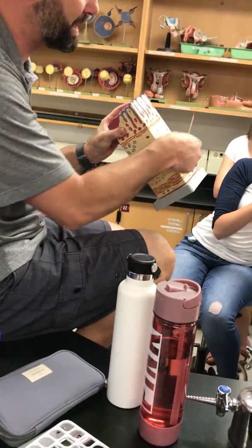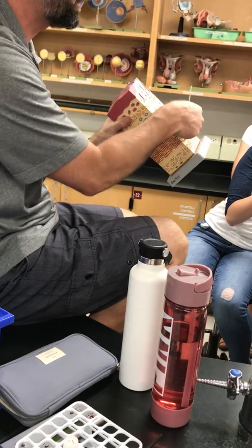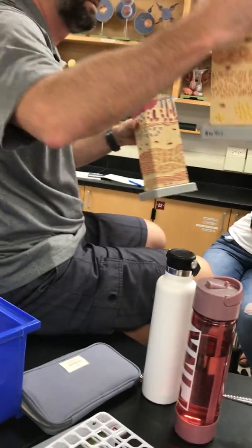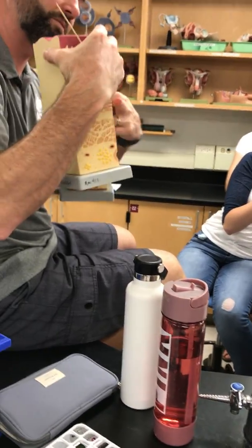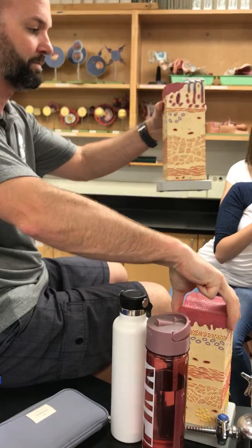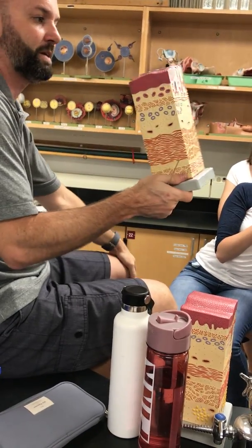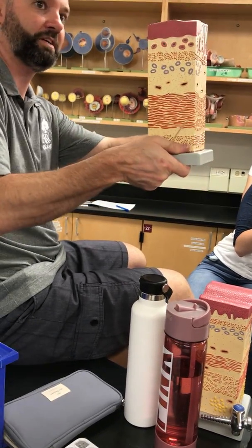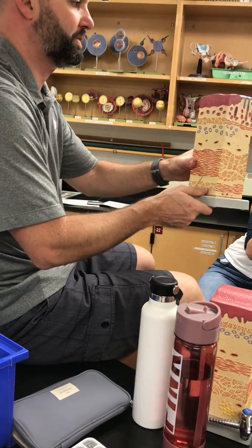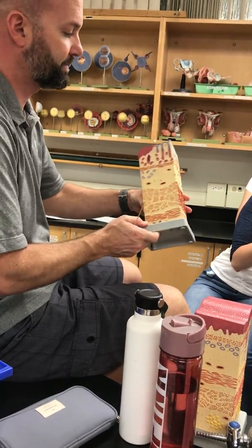But what do you notice about the thickness of this circular compared to what we saw here? Oh, so it's much thicker. Right, that's the inner circular on top, outer longitudinal at the bottom. You see how much thicker it is? So what sphincter are we at here? If you have thick circular smooth muscle, you've got a sphincter. Cardiac sphincter or gastroesophageal sphincter.